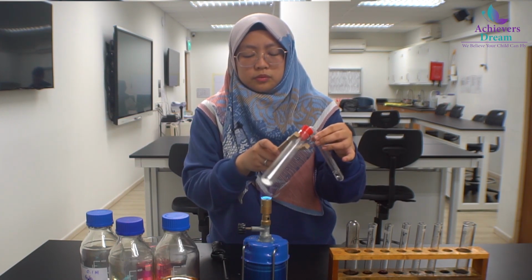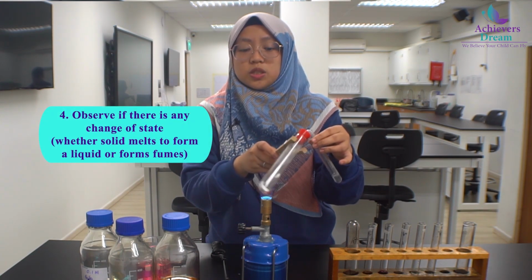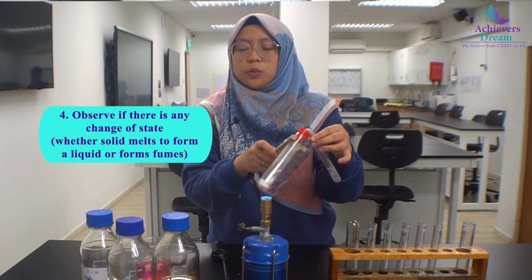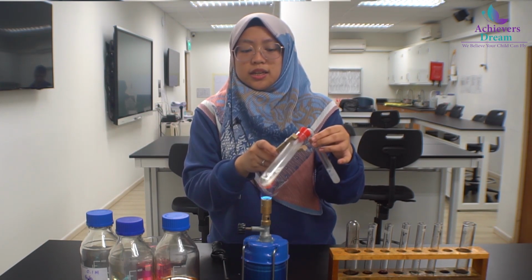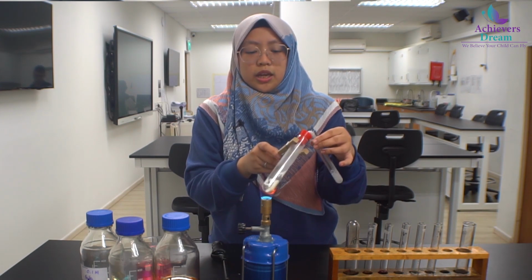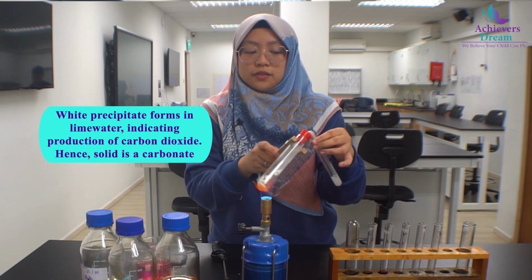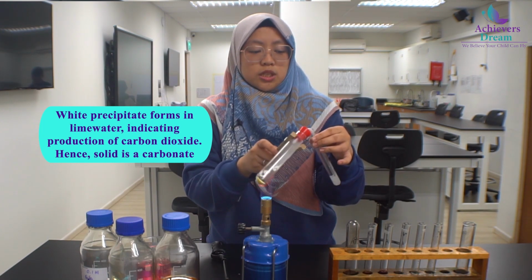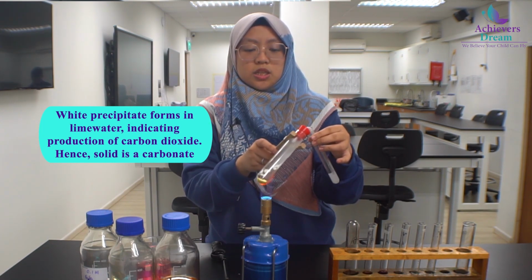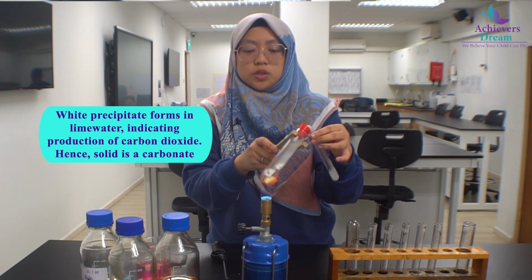Also observe the appearance of the solid while you are heating, whether there are any changes of state. So in this case, it still remains in powder form. And if you realize, the lime water on my left has turned cloudy, but this observation is not accepted for O levels. You should mention that a white precipitate is observed. So this indicates that carbon dioxide has been produced.